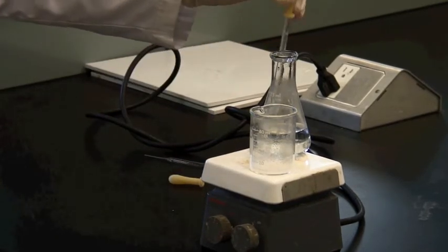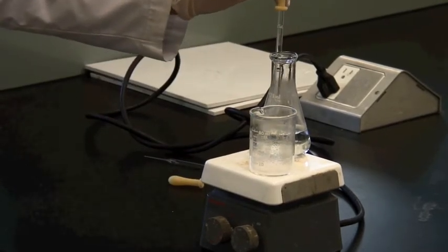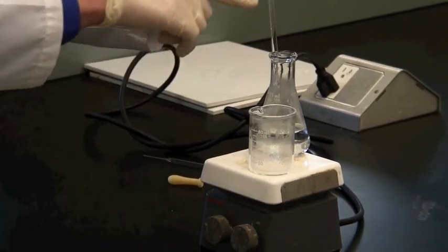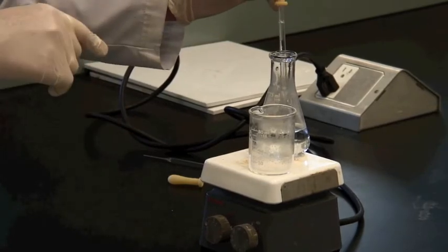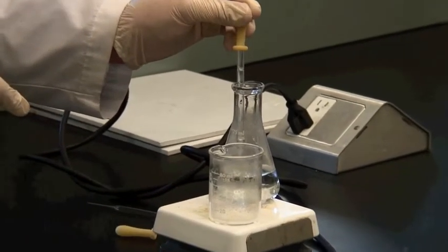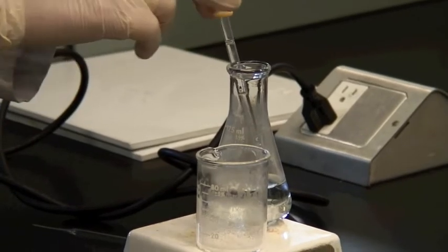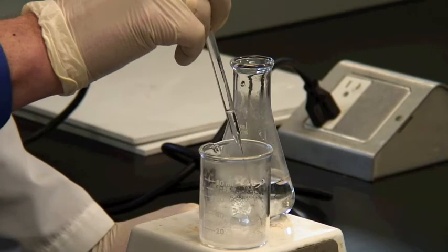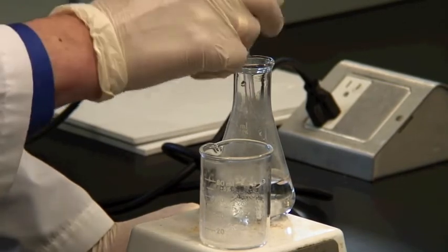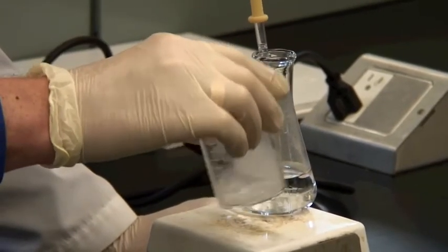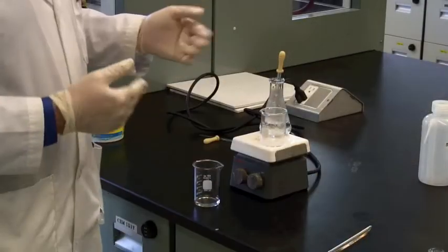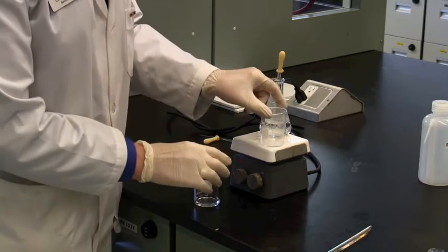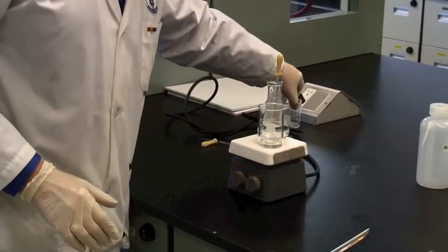While you are doing this, it's a good idea to flush your pasteur pipette with the boiling solvent just before you add it, because there's a large surface area here, and it will cool down. But if you make sure that the actual glassware is hot, then you'll have a better time of it. Still not enough, so I'll add some more until we're actually dissolved. I'm not going to sport with your patience watching this actually dissolve. So when it does dissolve, it'll look like that.